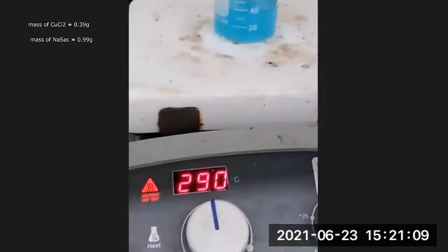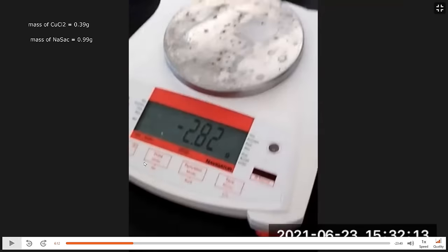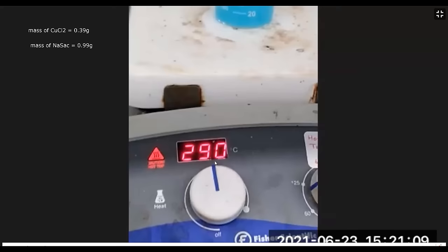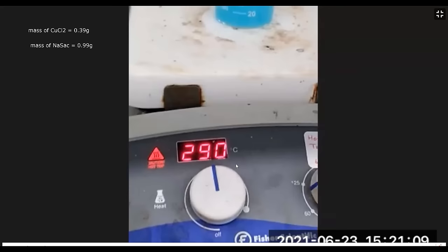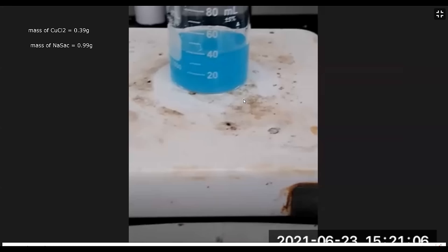Pour the copper chloride solution into the sodium saccharinate solution, then place this combined solution on a hot plate to heat. Add about five milliliters of DI water to wash any residual copper chloride from the beaker into the combined solution. Set the hot plate to around 290°, with a stir bar in the beaker. Heat until you start to see a little blue crusting on the edges of the beaker above the water level. While this is heating, you can start on the fertilizer part of the lab.